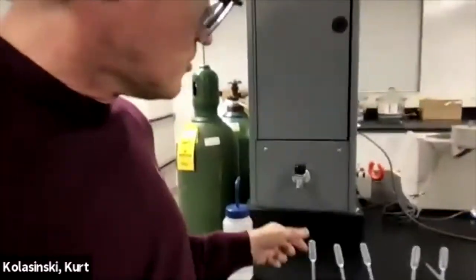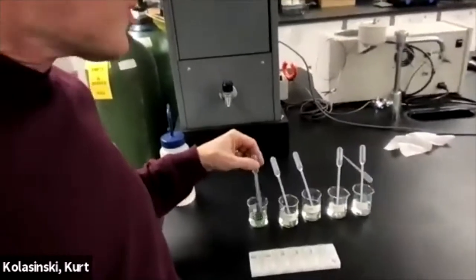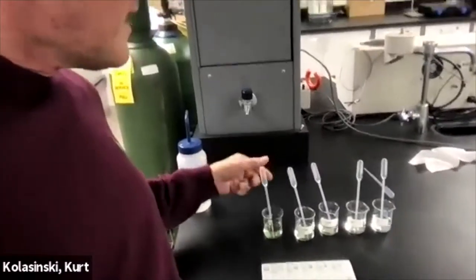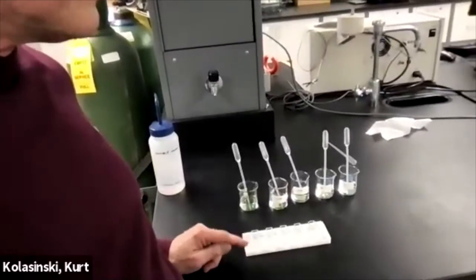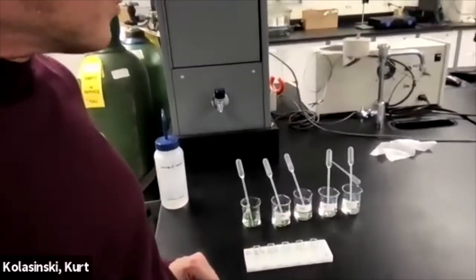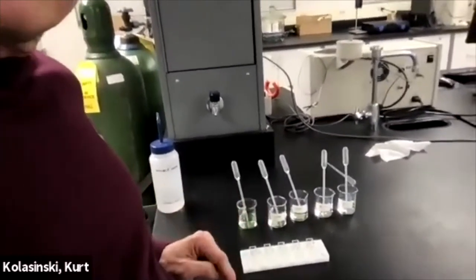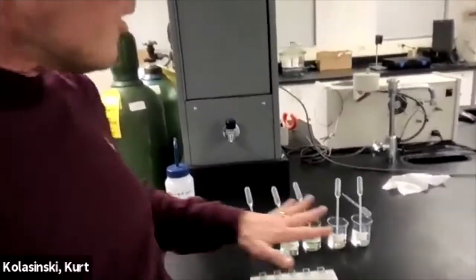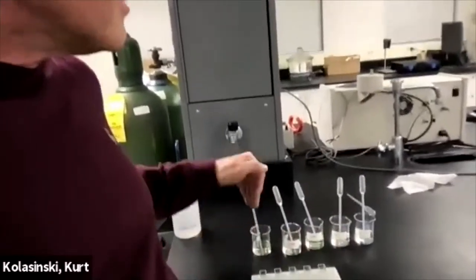We're going to use one transfer pipette. We'll stir things up and fill up as usual, you know, two thirds to three quarters of the way, a four-sided clear cuvette. One for each solution.